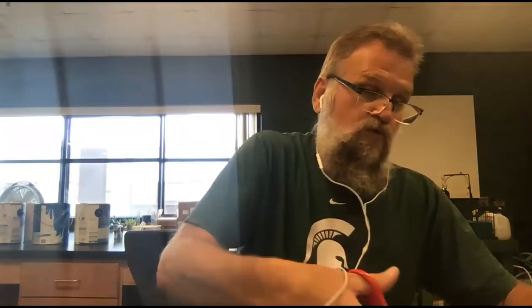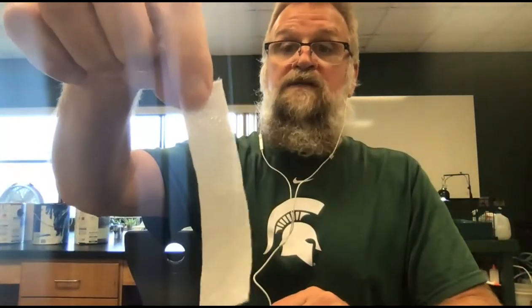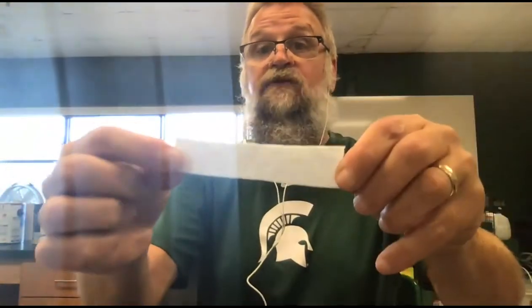So that's 2 by 10. All I did was cut out a piece of paper towel that's approximately 2 centimeters by 10 centimeters.